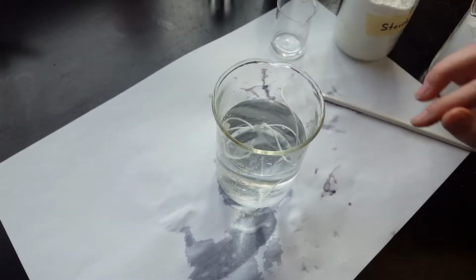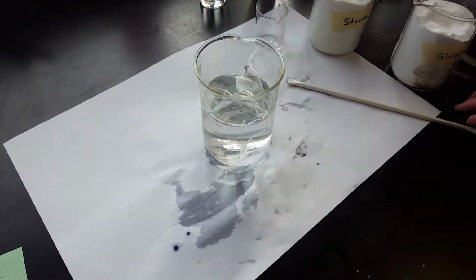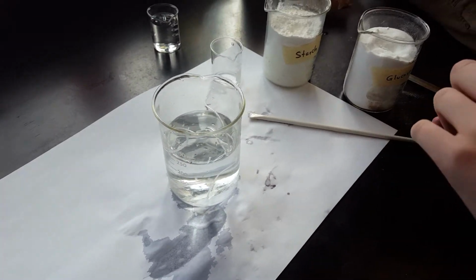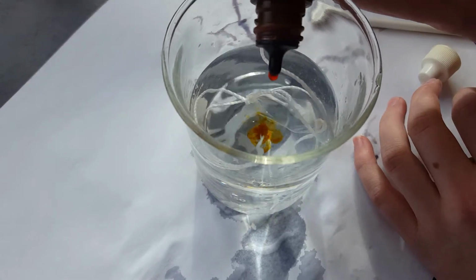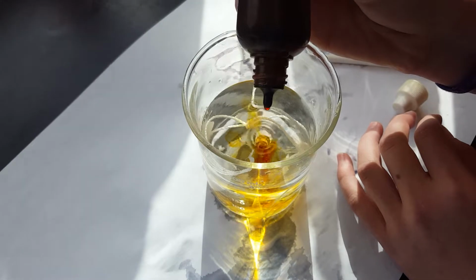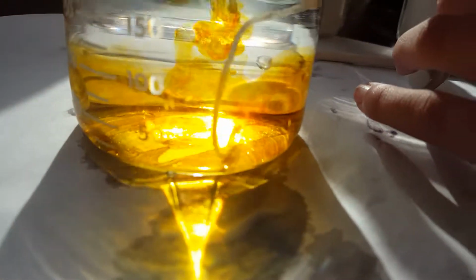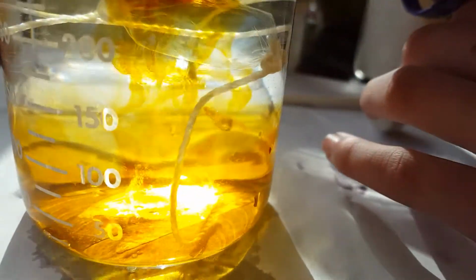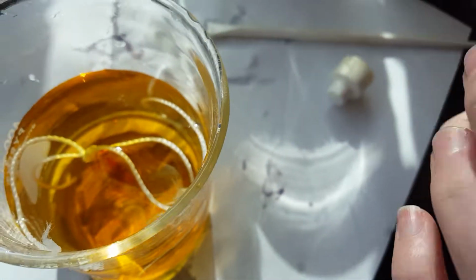So to do the lab, we're just going to run quickly through part one procedures. Student assistant number one is going to add iodine to the beaker of water. There's nothing else in that beaker except water in the cell. So she's going to add about 40 drops, and she's counting those off. While those drops of iodine are being added, you should notice what color the solution is turning. This is a pretty typical color for iodine to turn water. Good job. Give it a quick stir.